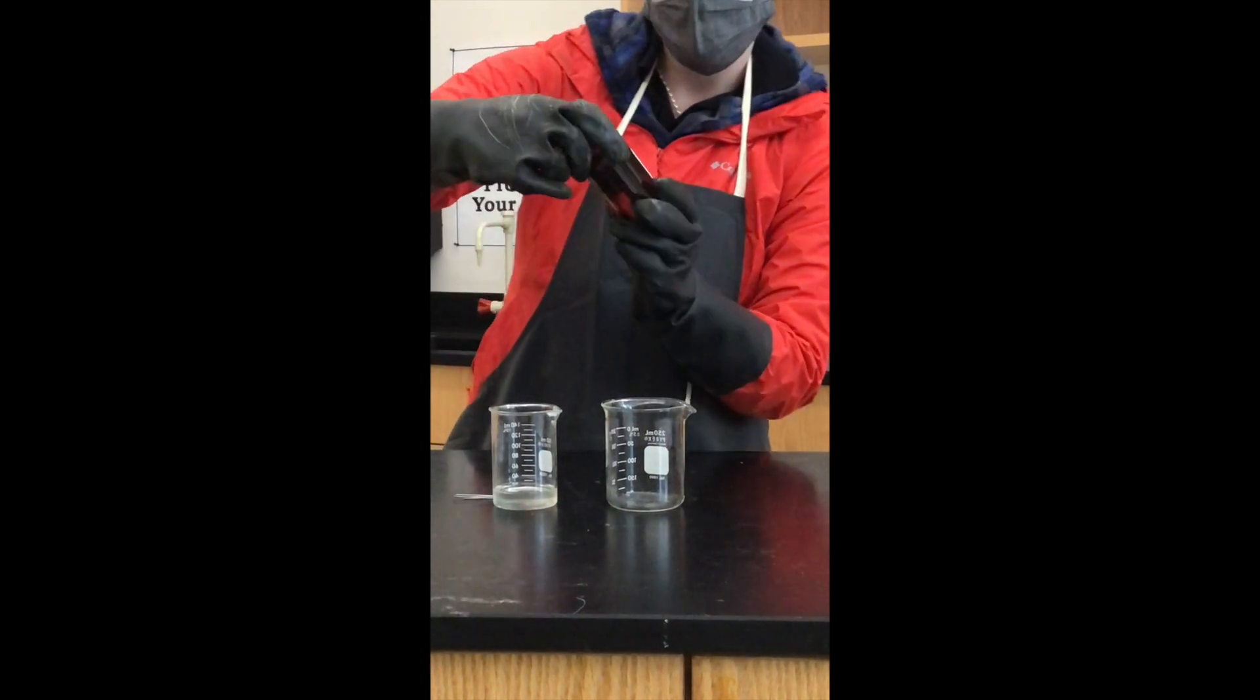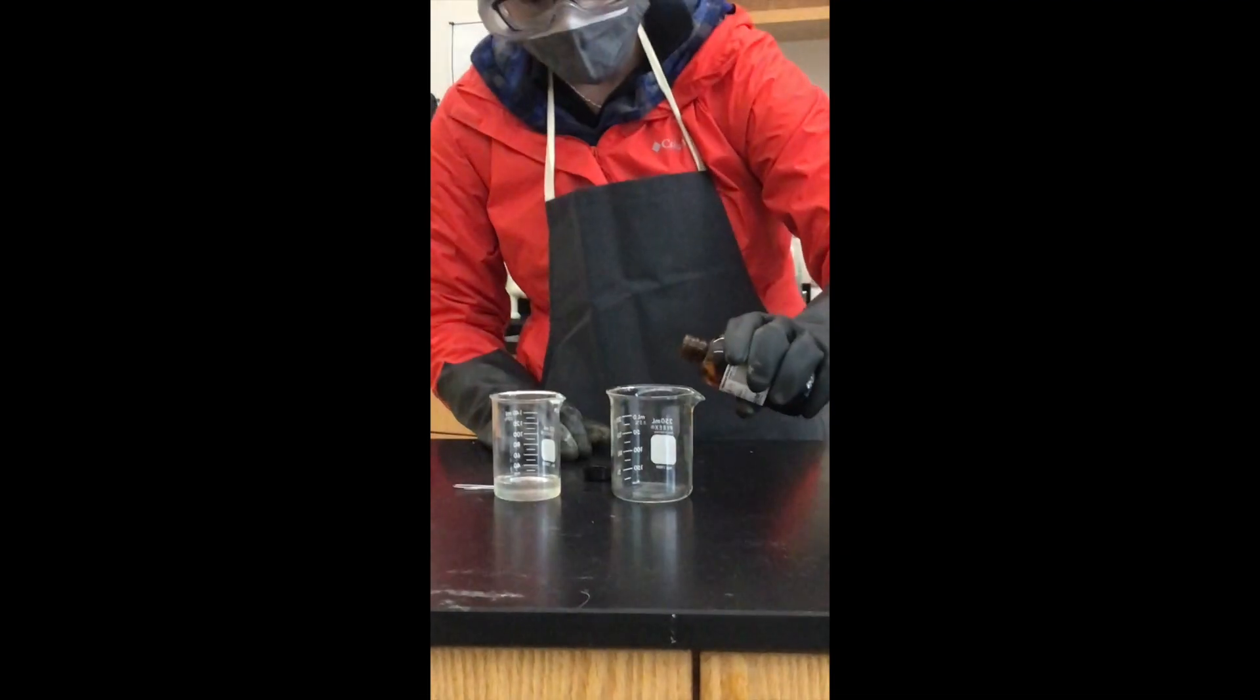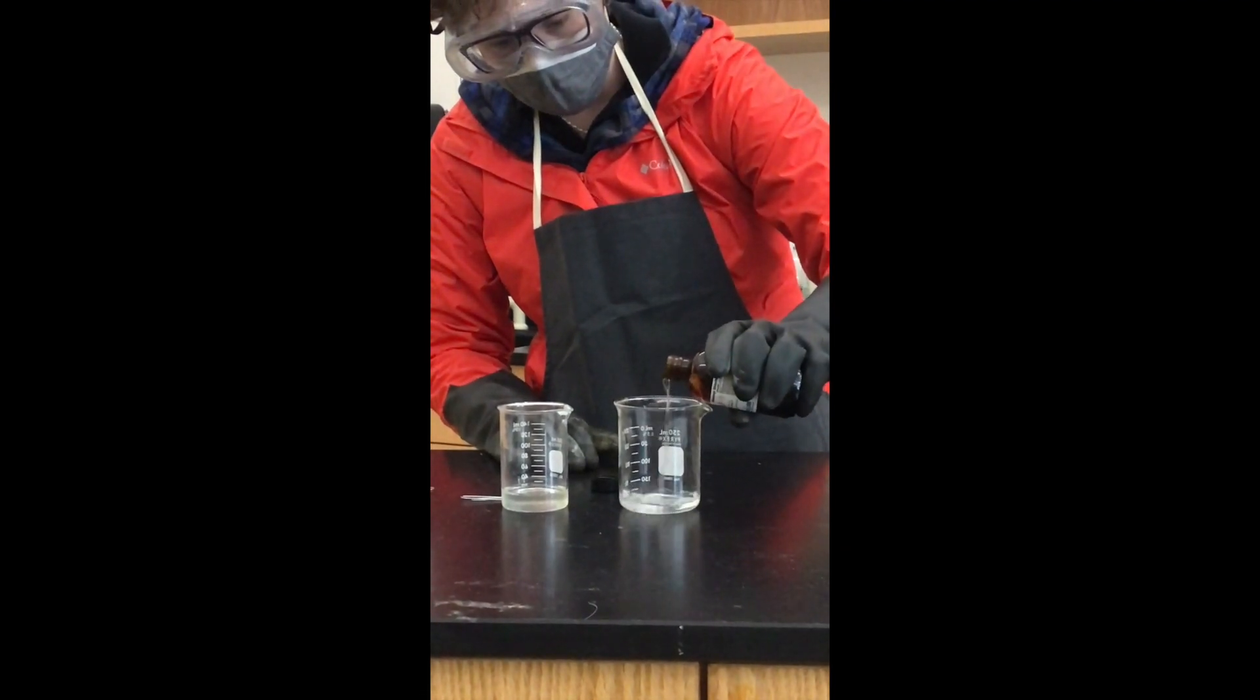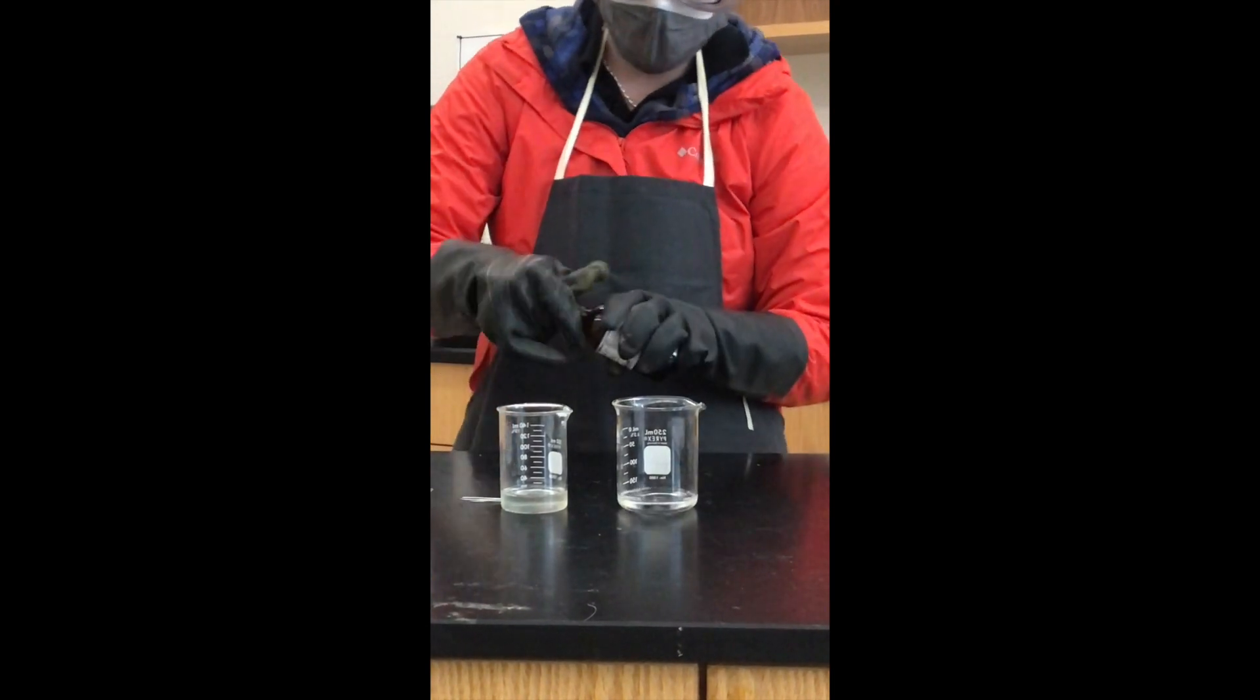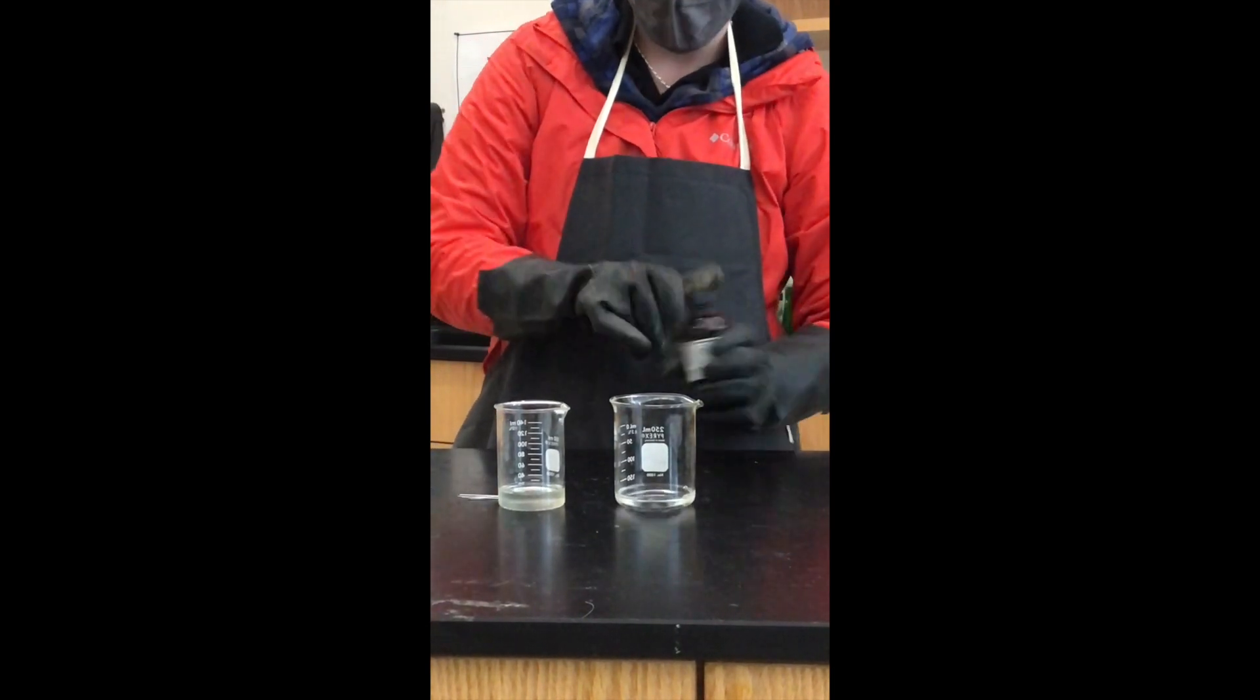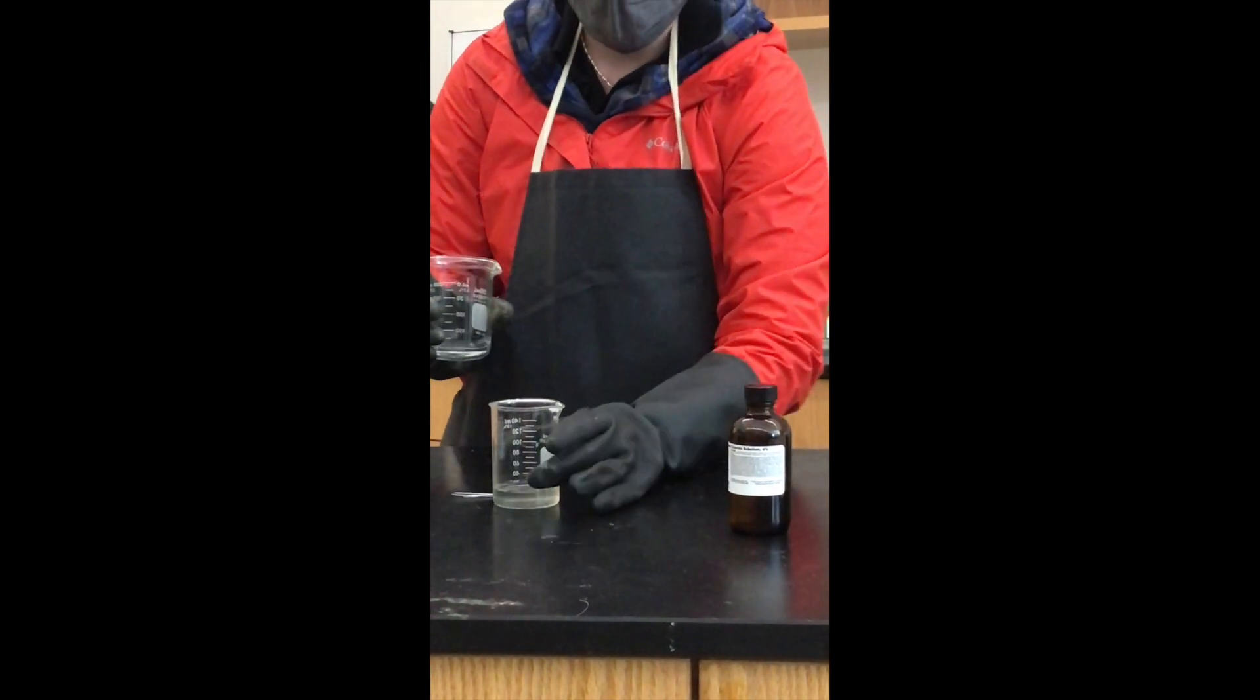And this is sebacoyl chloride solution, also six percent. Now if I were to just combine them, like pour it in super fast, nothing would happen. It would get all mixed up and look kind of gross.